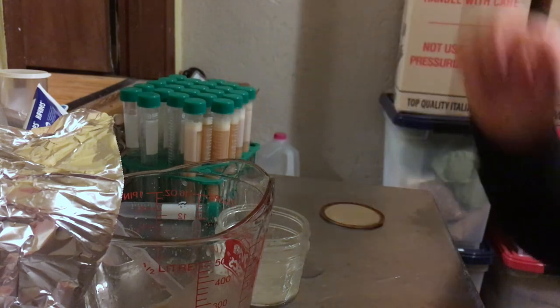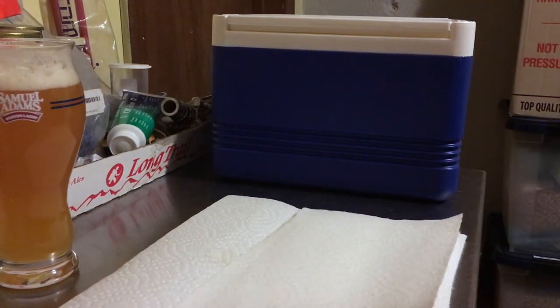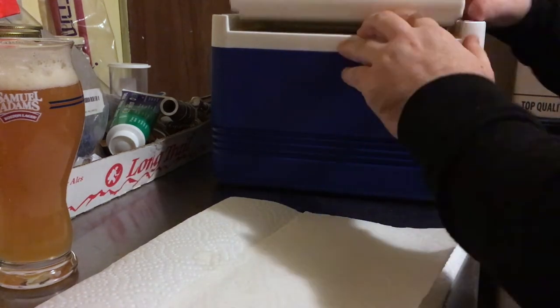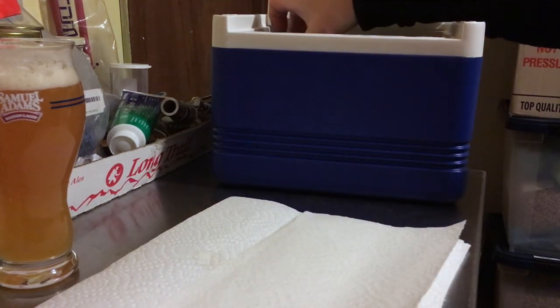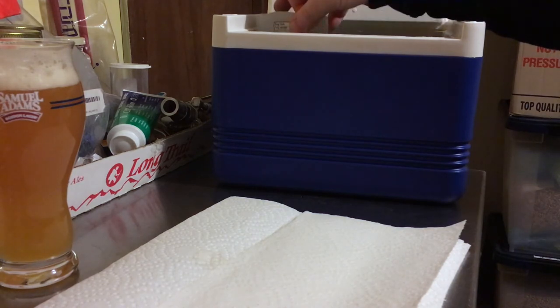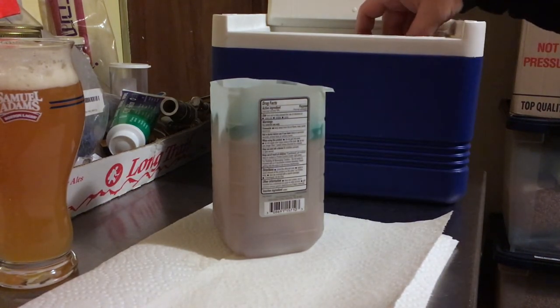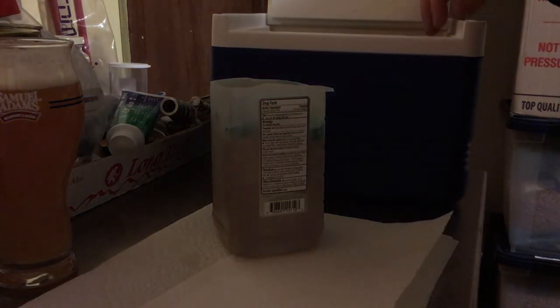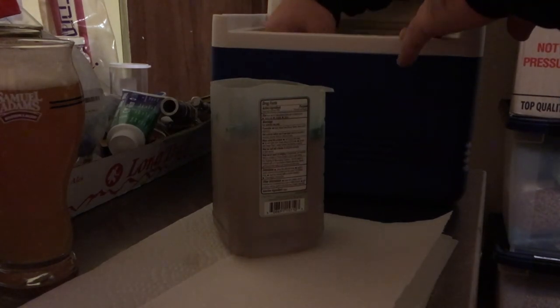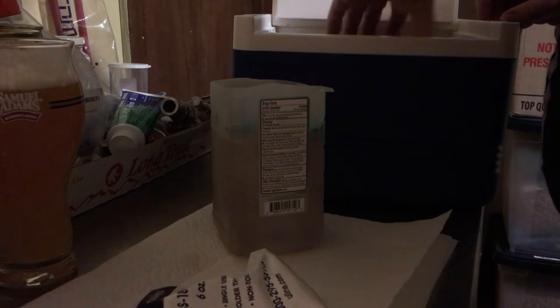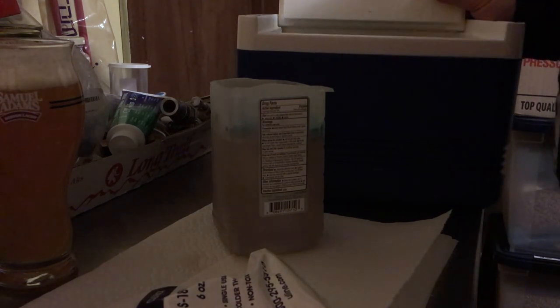Hello folks. Back, 24 hours or thereabouts has passed from my little yeast freezing video. Here is my frozen vials from last night. Let me take out some of these ice packs.